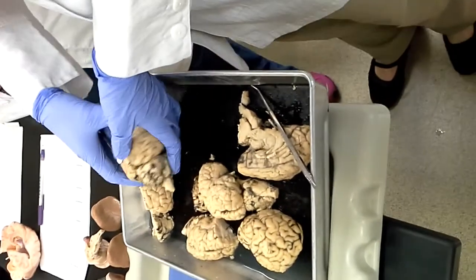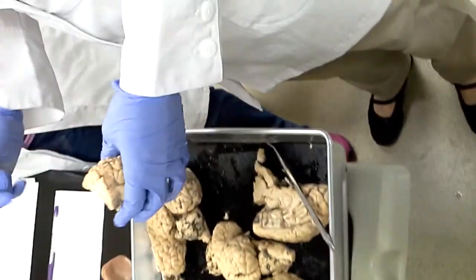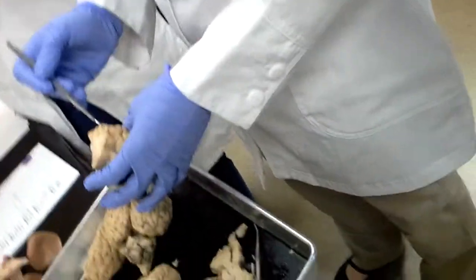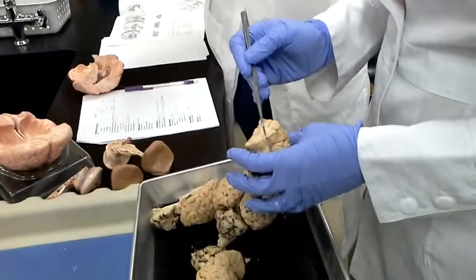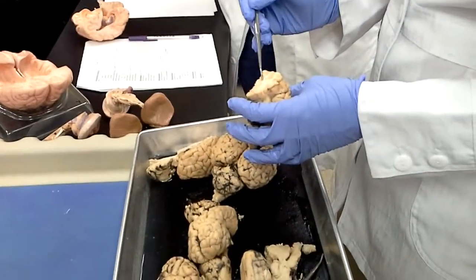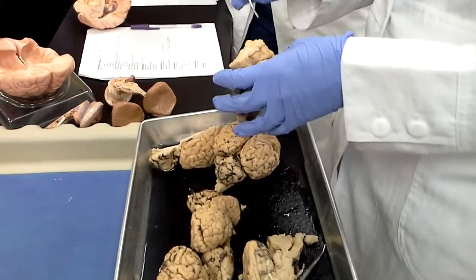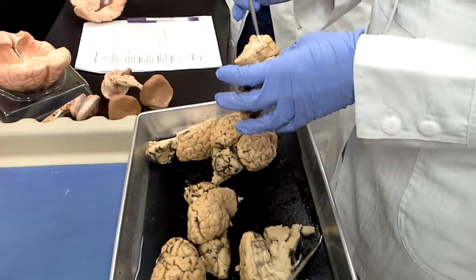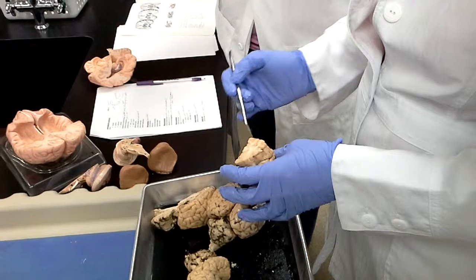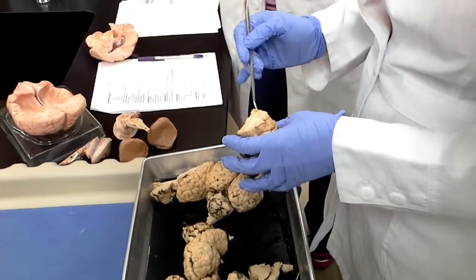The cerebral cortex is, I have one that's been cut into the lobe so we can see, can you see the gray matter? Here, that's the cerebral cortex. You guys remember what kind of stuff you find in gray matter? Why is it gray? It's no, that'd be the white. Oh. It's unmyelinated. That's where cell bodies are located, and in unmyelinated axons. The white matter is where we have myelinated axons running. So just this outside folded edge, that's gray matter. That's the cerebral cortex.